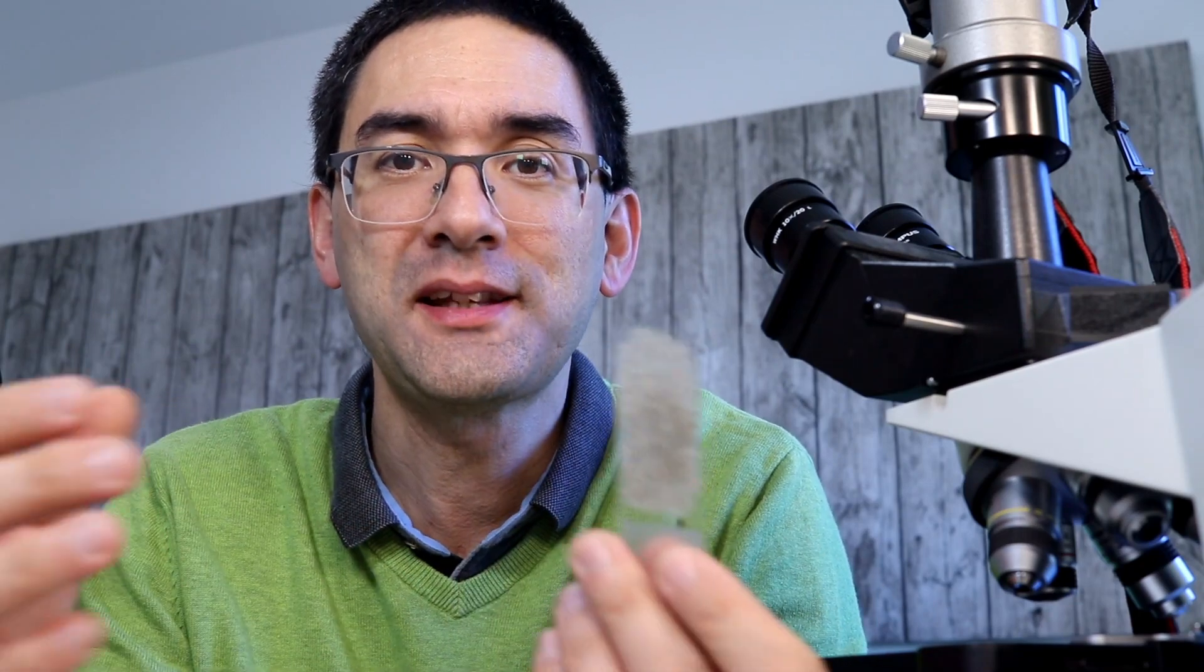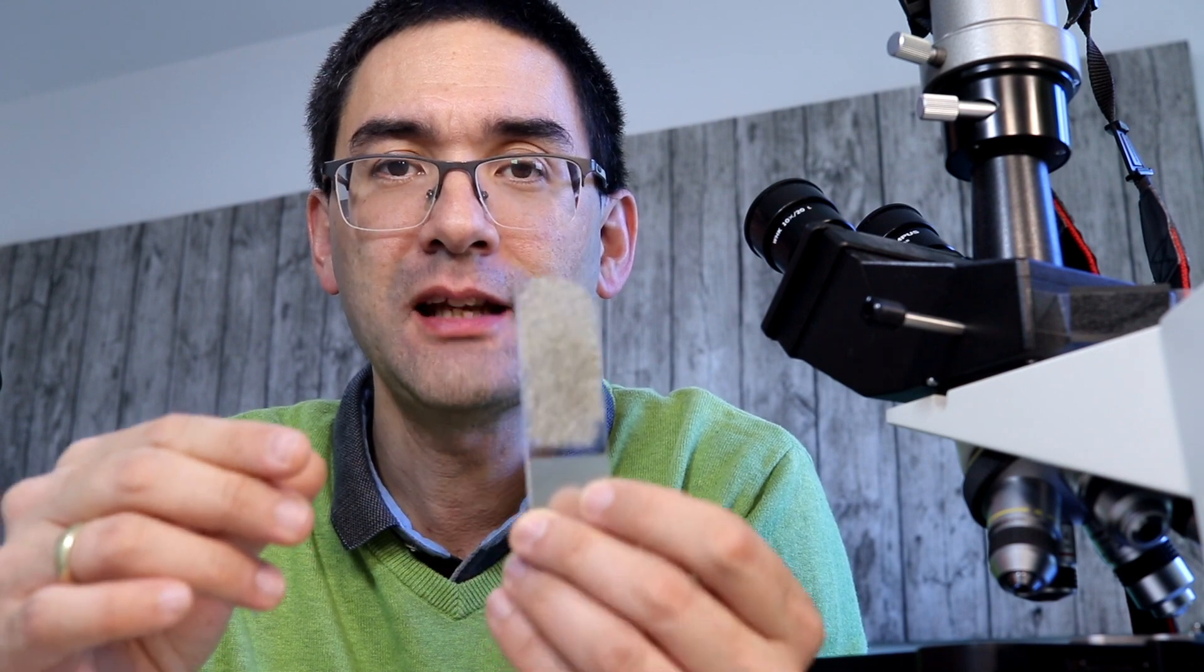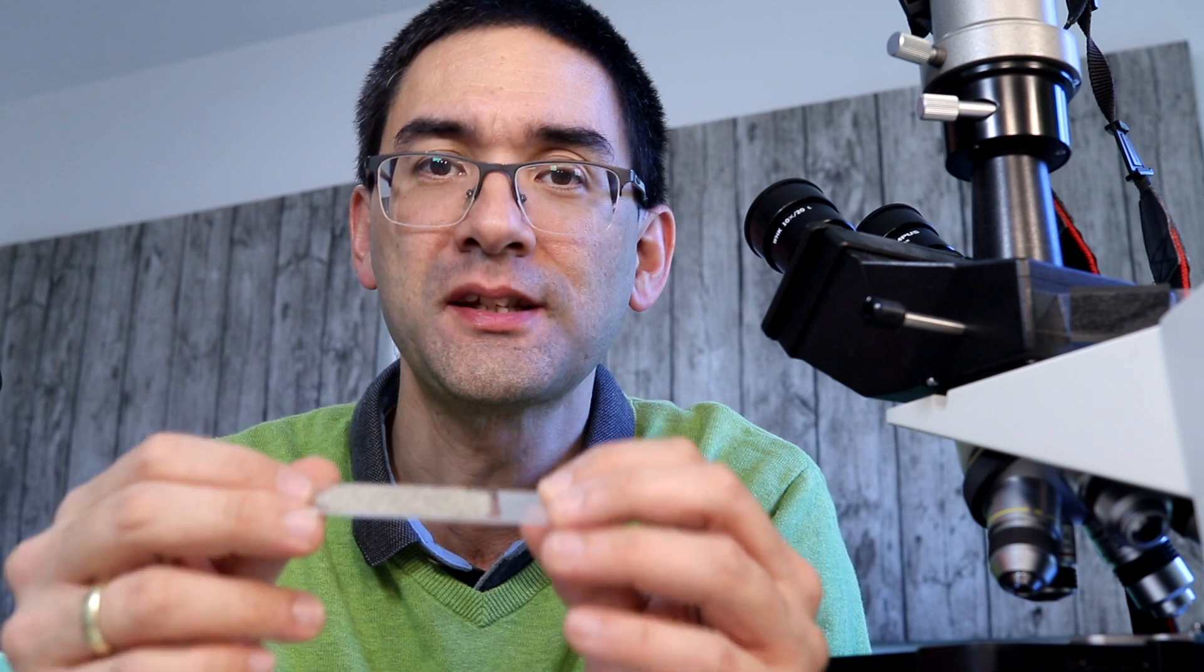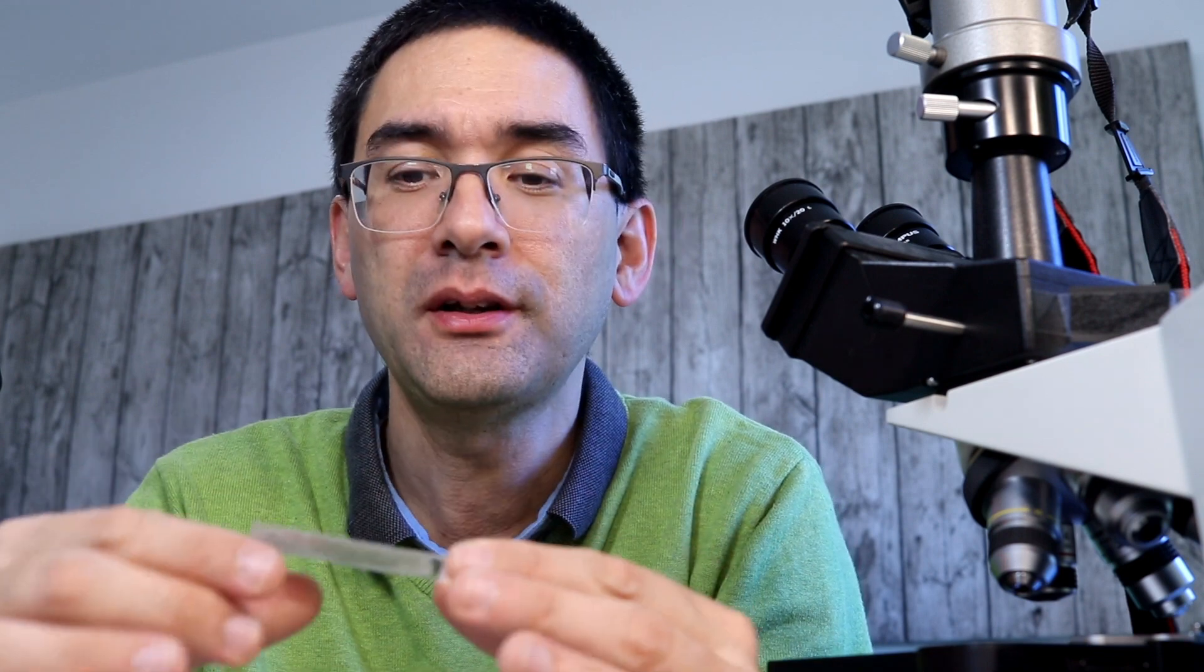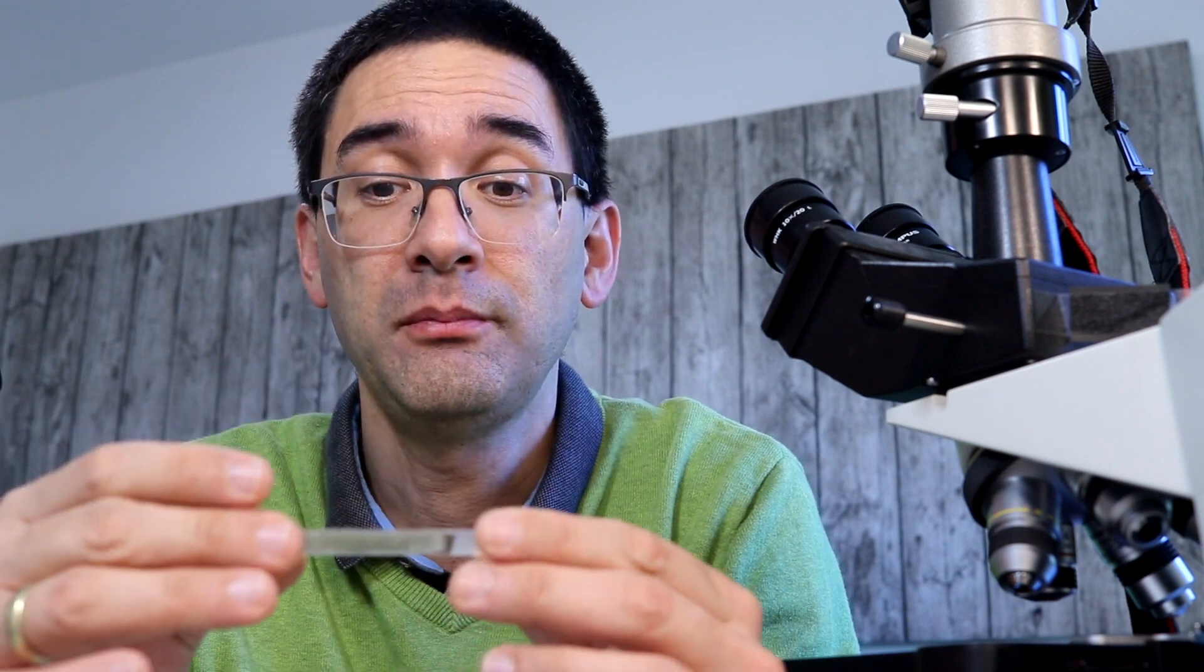So why would you actually do that? Well of course there are people who like to collect sand, that's one thing, but I think another reason why this can be useful is because the sand is very flat on top of the slide and spread apart. This allows me to see the individual sand grains better and this way you can I guess also use this method to determine any pollution like microplastic pollution or things like that. Yeah because it makes it very easy to observe because the sand is very regular and flat on the slide.